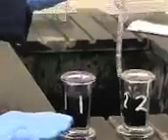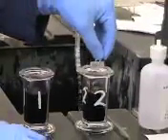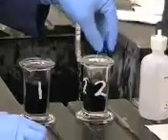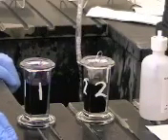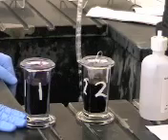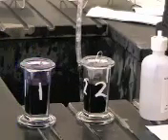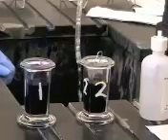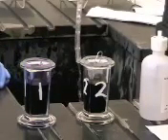You're then going to put your slide with your paper clip into the second cup. So what this second cup is, is Gram's iodine. So this will actually complex the crystal violet stain so that it will get stuck in the gram-positive bacteria, but it will allow it to get washed out of the gram-negative bacteria. So only the gram-positive bacteria will be stained purple.